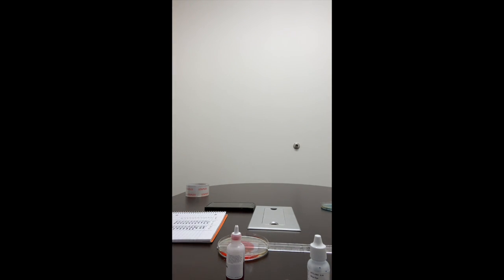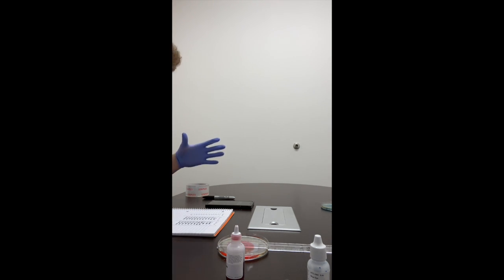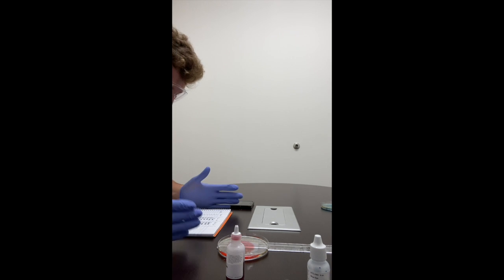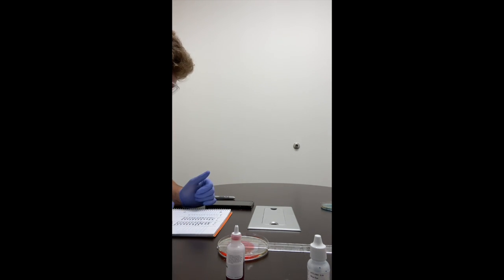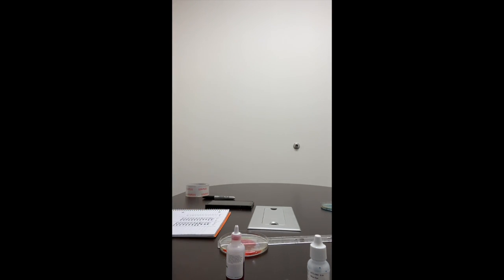So it moved about the same as the blue dye distance-wise, but it did more rapidly, and as soon as it went out to 6 centimeters, so as soon as it traveled 2 centimeters in 10 seconds, it kind of just staggered and eased its way back out. From 10 to 30 seconds, still that 2 centimeter range, and then from 40 seconds to 60 seconds, it moved about a quarter, and then another quarter, which ultimately gave us 2.5 centimeters as the total distance throughout the 2 minutes. So that is the diffusion lab.